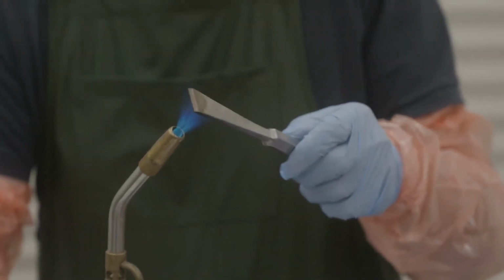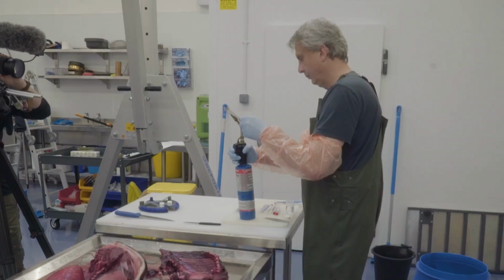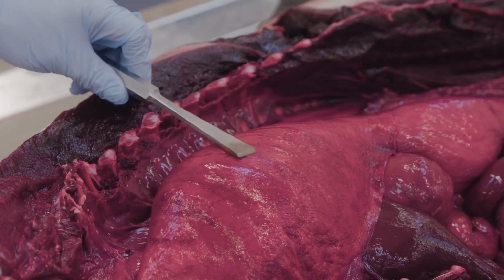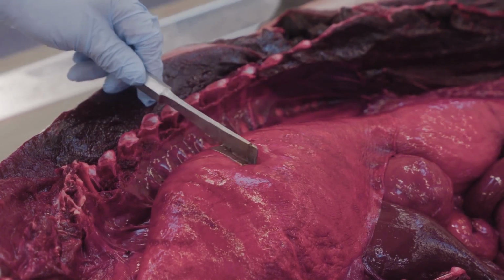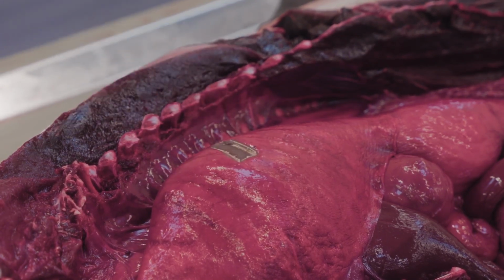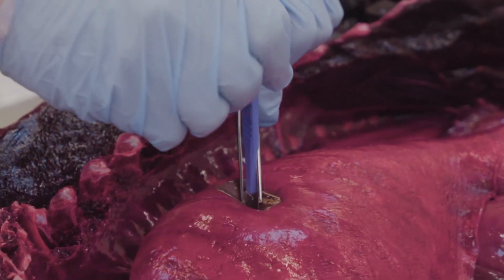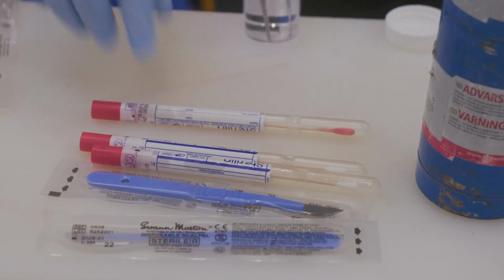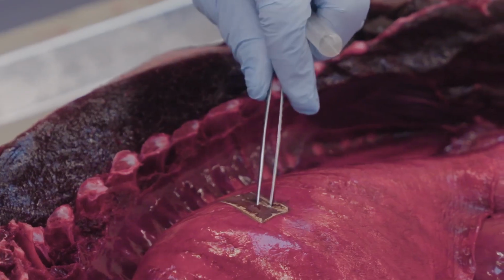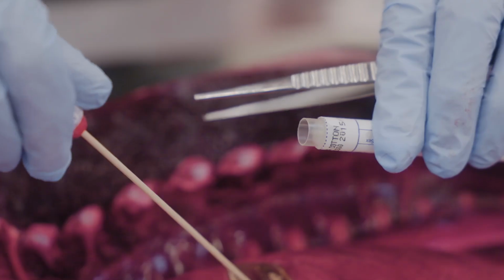For bacteriology, always sample from uncontaminated tissue. If possible, sear the outer surface of the organ using a clean, heated spatula or blade immediately prior to sampling. This destroys any surface contamination. Then, use a sterile scalpel to make a small incision into the tissue and insert a sterile swab into the freshly exposed interior. Rotate the swab gently to collect material from within the organ.